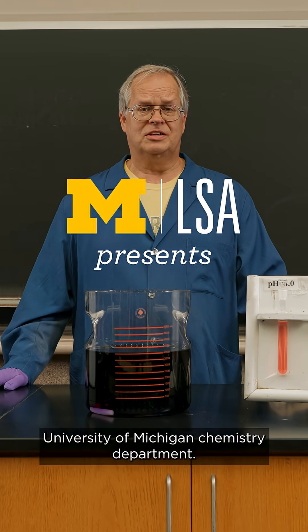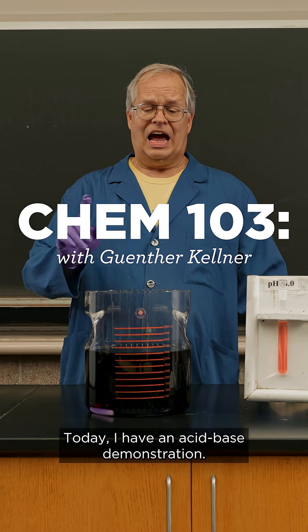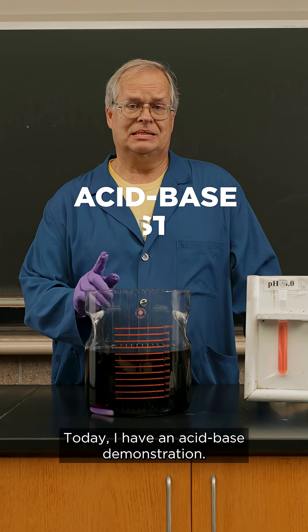Hello Gunther from the University of Michigan Chemistry Department. Today I have an acid-base demonstration.